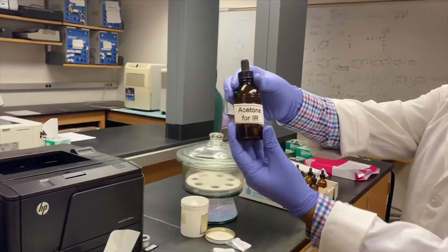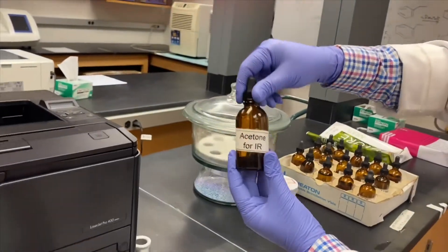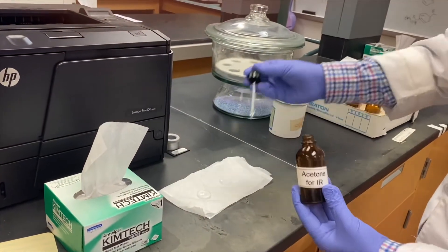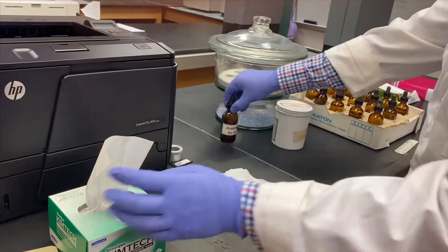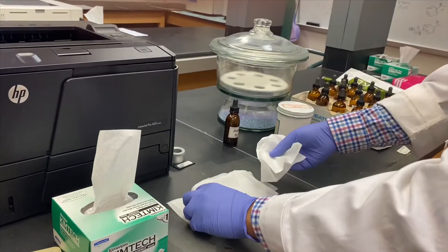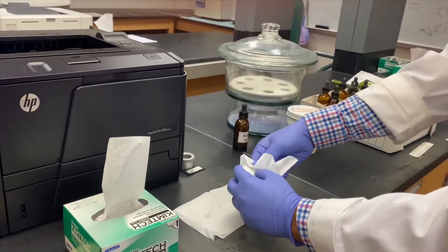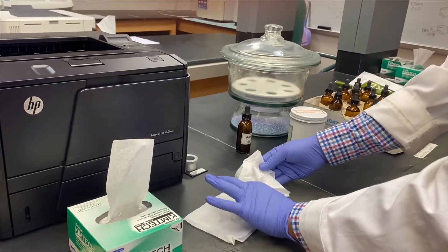Using a specific solution of acetone for IR, we will clean these salt plates. Use a few drops of acetone on these plates and wipe them carefully with kim wipe, being careful not to touch the plates with your fingertips.